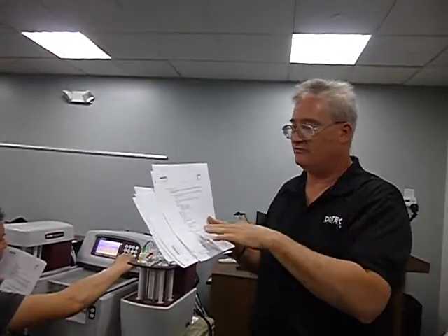And in the faster speed, you just let it sit a little longer and grab more in there. Because what it doesn't grab, as soon as it clicks and starts pushing the other way, that stops. And there may still be some more that still need to come. If it happened too fast and it pushes through, that means your line volume is going to be off.